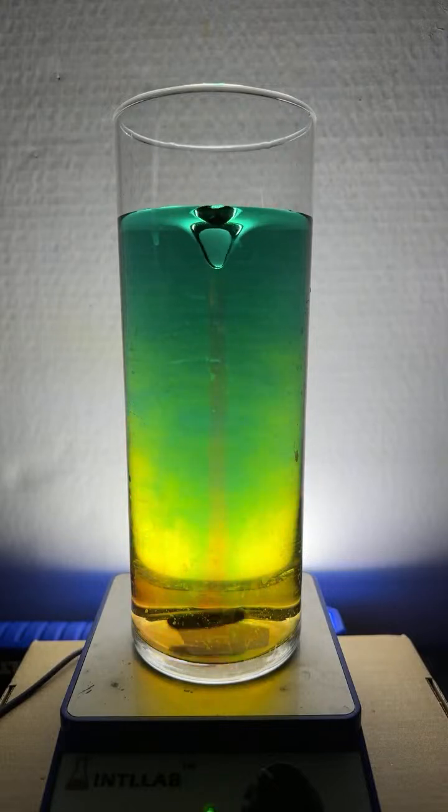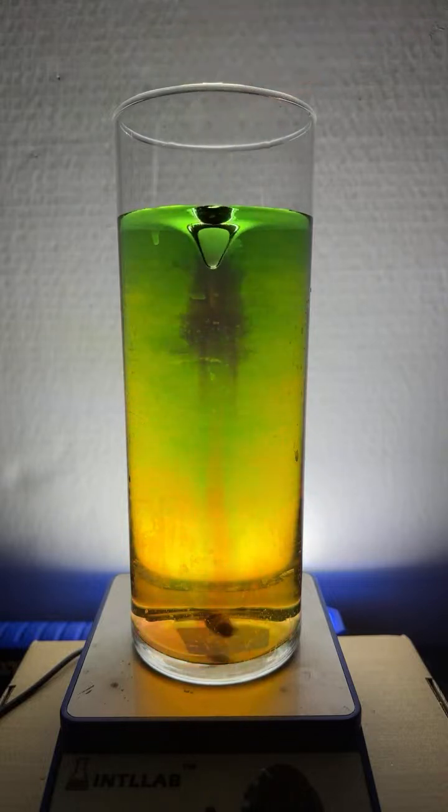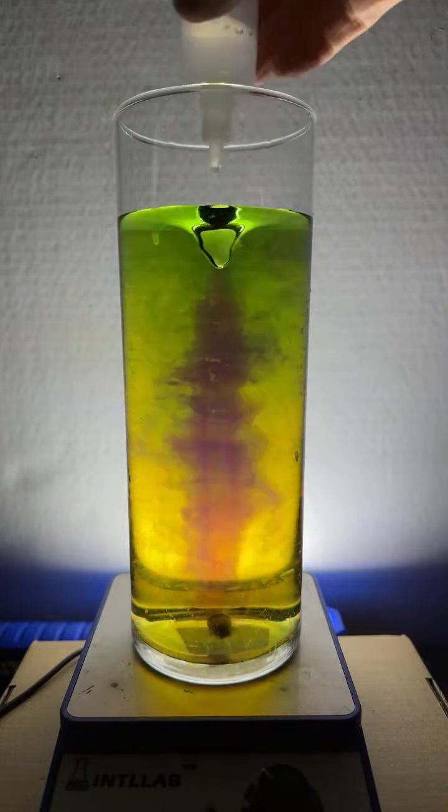Just curious. Add a bit more base. Three drops. Chase it with a bit of acid. See what we get.